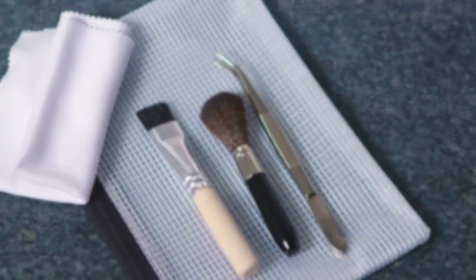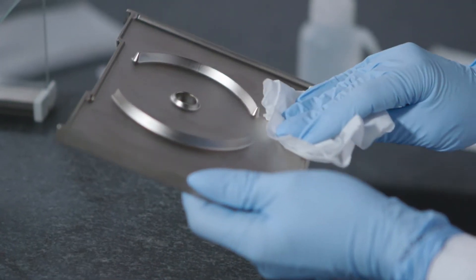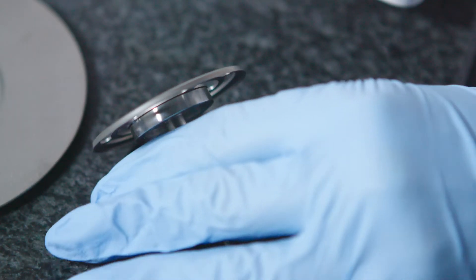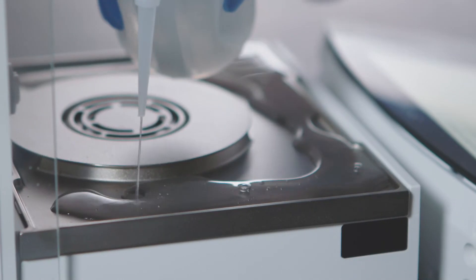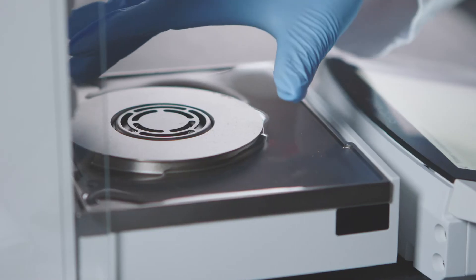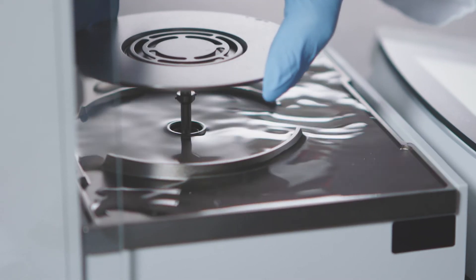How else do we support the cleaning process? For example, we provide you with a kit of useful cleaning tools you need. The metal parts of the balance are very resistant to chemicals, so you can wipe them down without worrying about damaging the instrument. The base plate itself is designed to prevent liquids or solids from getting into the inner parts — in fact, the plate can hold spills up to 50ml, so your workbench stays clean.